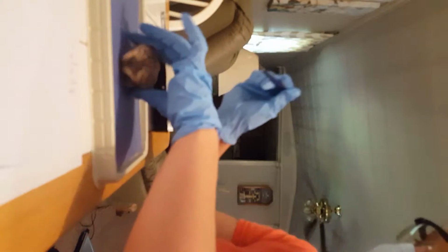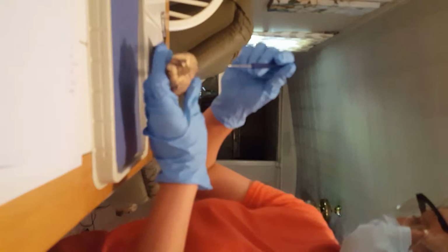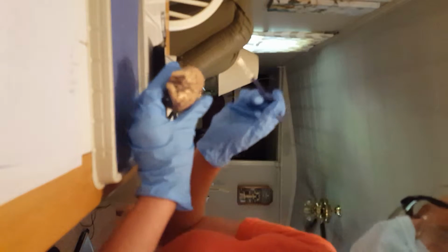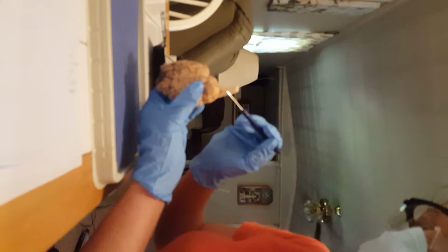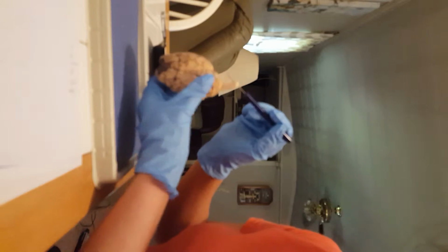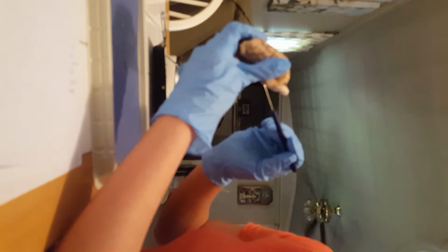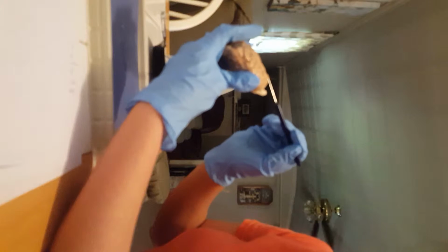That will be right here on the front of the brain. Then I'm going to do the brainstem, which is obviously right here. The cerebellum, which is right here. Or, I'm sorry, right here, I guess. Right here.